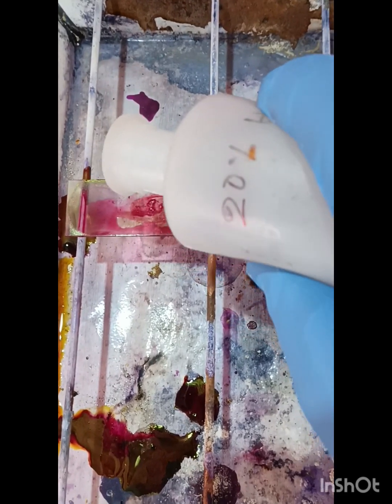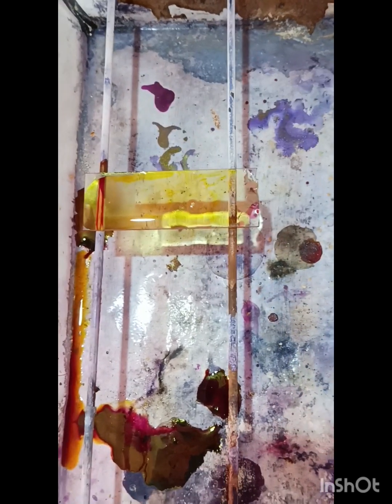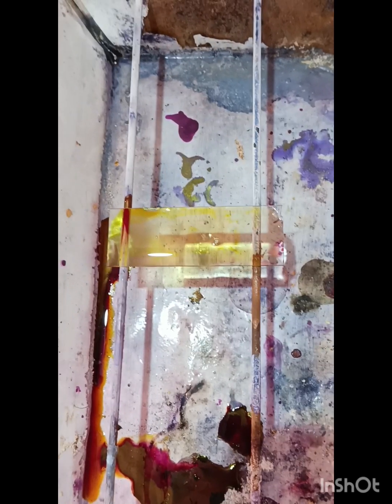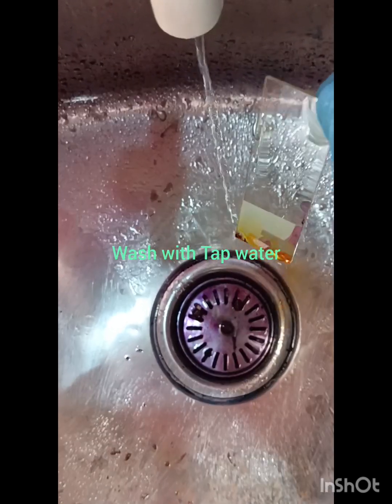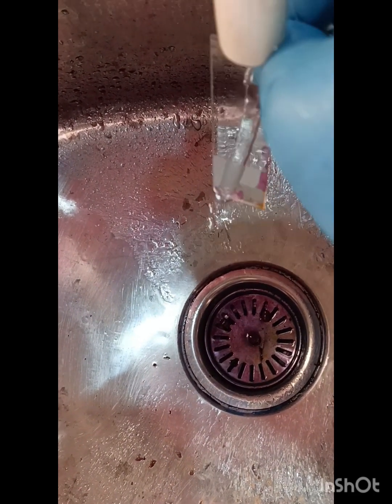Then put 20% H2SO4 for decolorization. We have to observe the smear until decolorization. Discard the 20% H2SO4 and wash it properly with tap water.